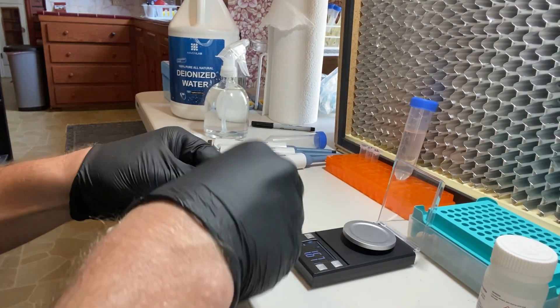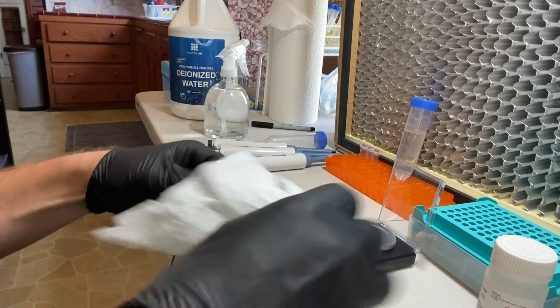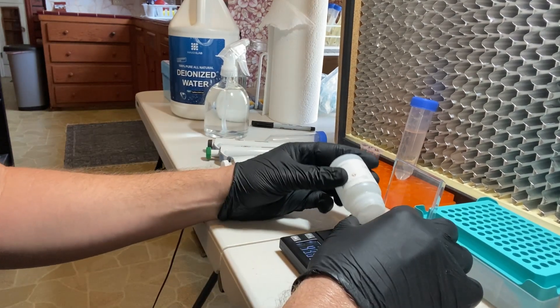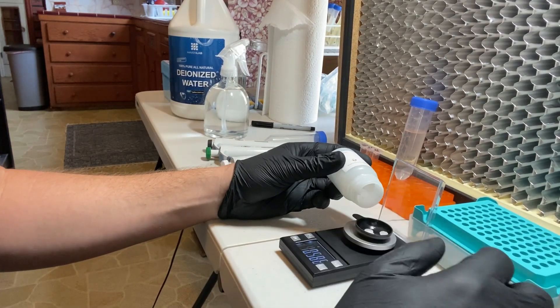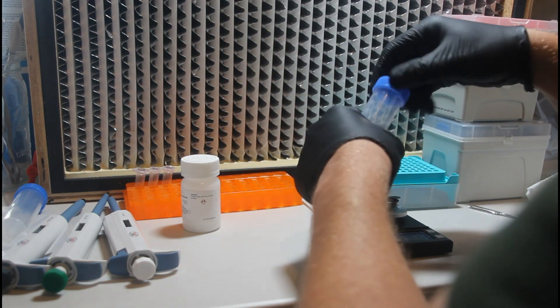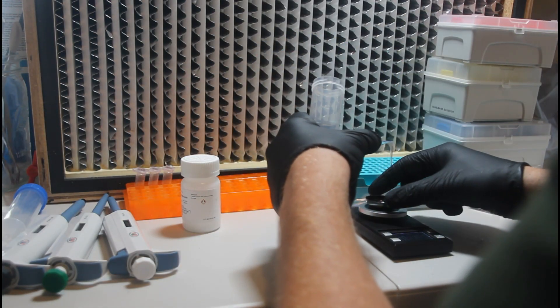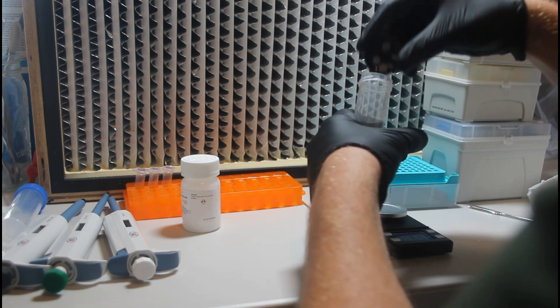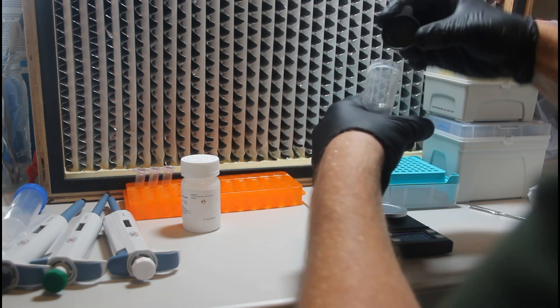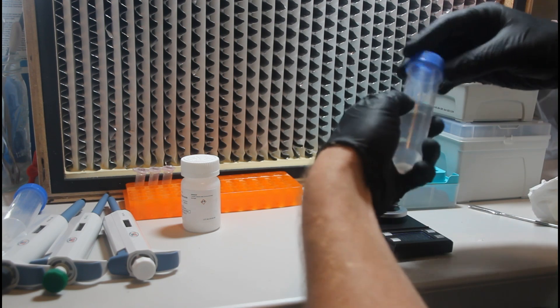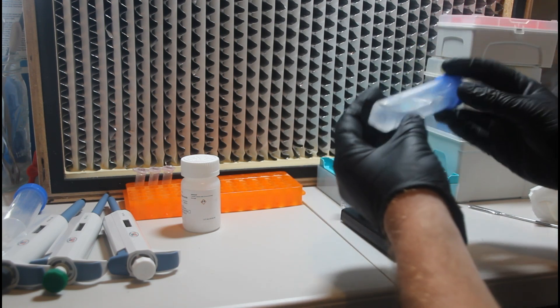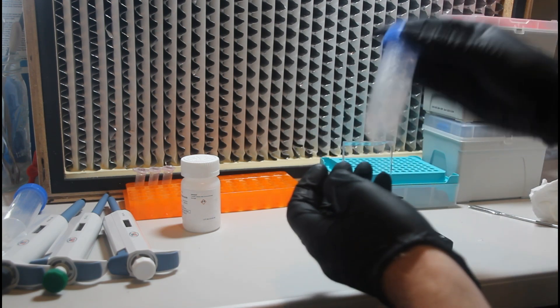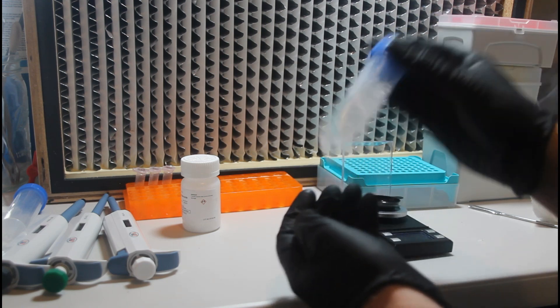You'll note that I am wiping everything down as I go, just to lessen the chance of introducing contamination into the solution, since this will be getting mixed in with the fungal cells. Note that once you add the sodium hydroxide crystals, you will want to mix it thoroughly and you will also note that it is an exothermic reaction, so you should feel the tube get slightly warm.